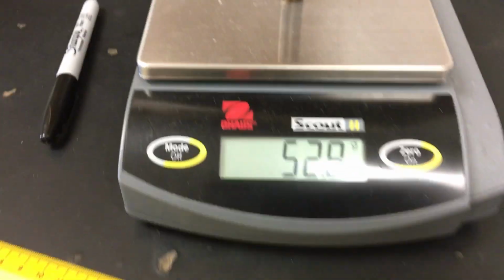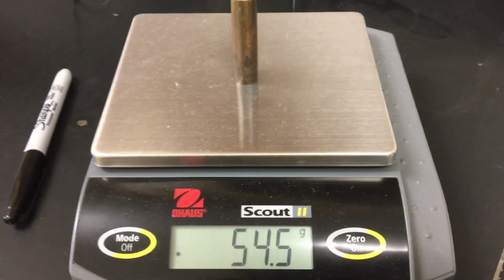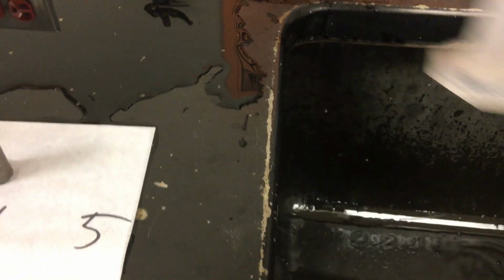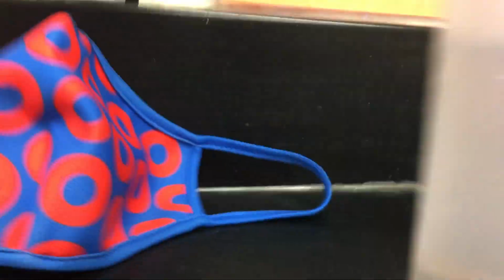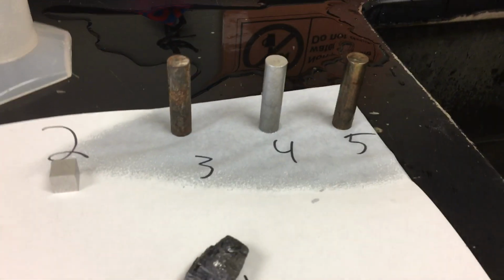Number five, which is wet because I've made a mess of the station, but I'll dry it off. There we are. Mass for number five. Get some water. 45 again. And we're at 51 again, which makes sense. I mean, these are built to all be the same, so that'll be that. So that should get us 1, 2, 3, 4, 5.